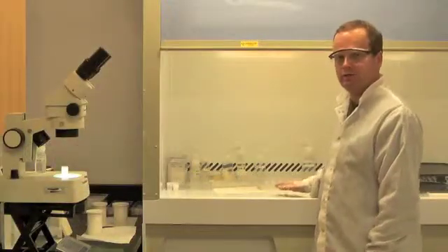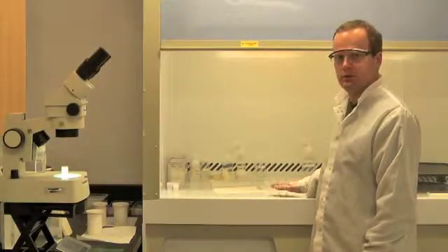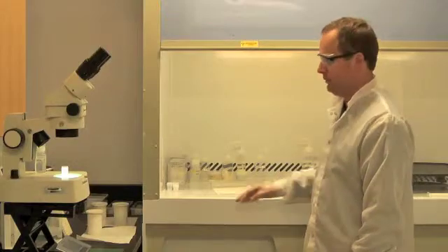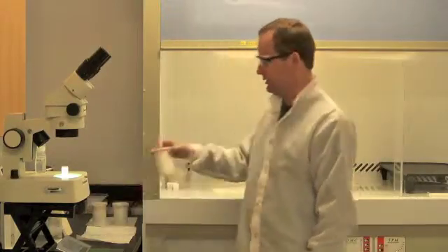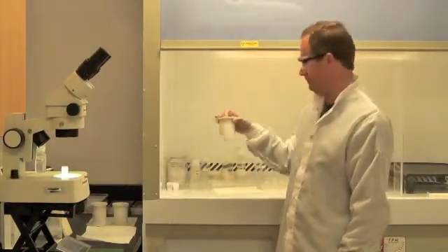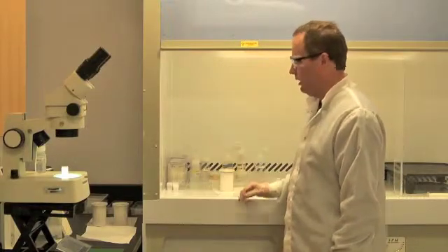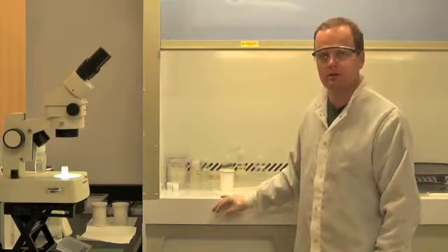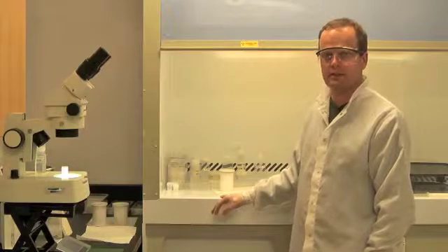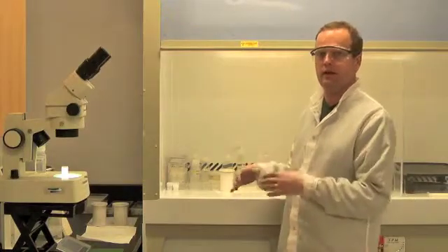Once I've finished loading all 15 crystals into individual microcapsules, I'm going to place those capsules into this Teflon container. Bring that into the oven room and place it in the oven in a steel jacket at 180 degrees for 12 hours.